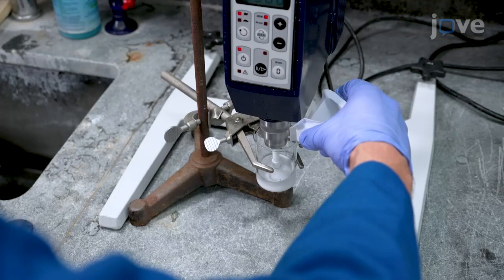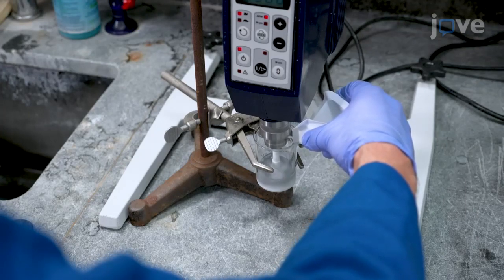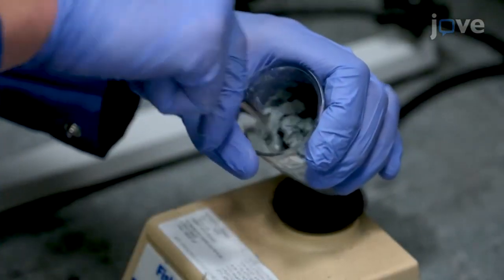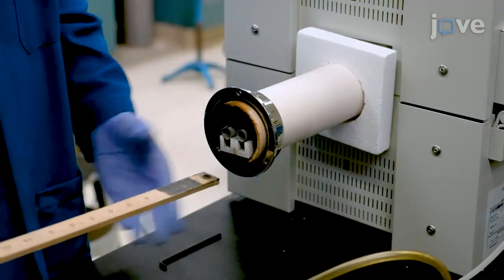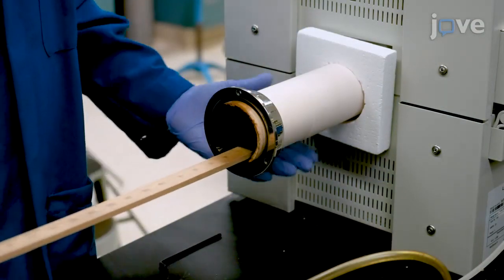The main advantage of this technique is that one can easily tune the structure of the zinc electrode by changing zinc particle size, type of porogen and its size, or heat treatment protocol.